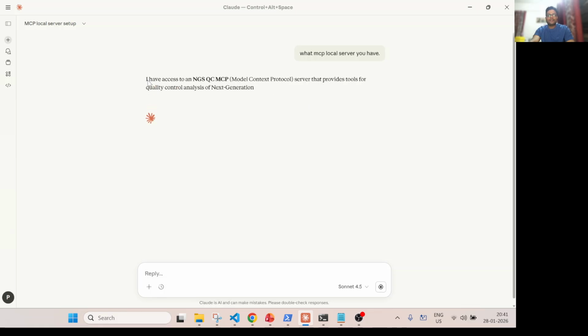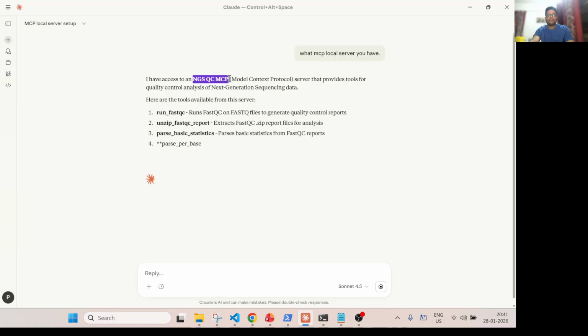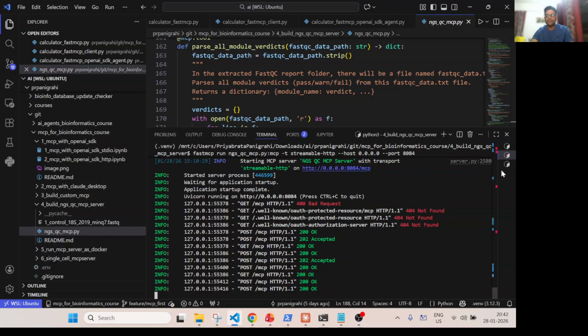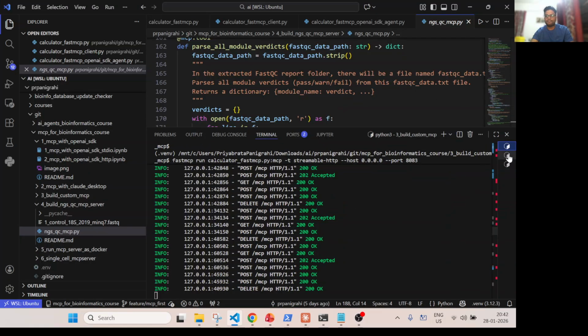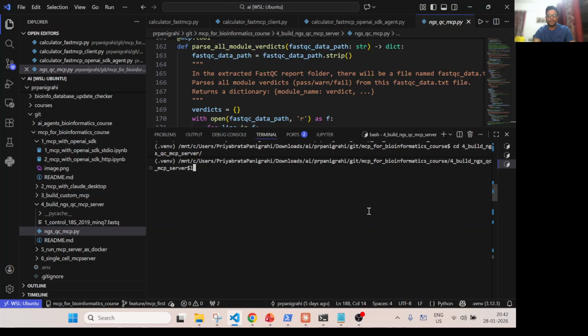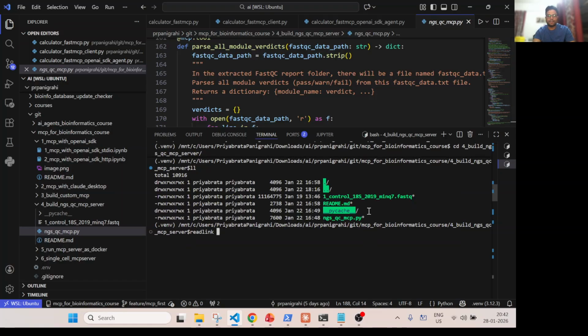So now it sees that I have access to the NGS QC MCP server, and I have these 5 tools: run FastQC, unzipping, this one, this one, this one. So can you run a FastQC? For that we have to give the file, right? So my file is present in this location. Okay, so let's go to the fourth one here. This is the file, right? So I can get the path.